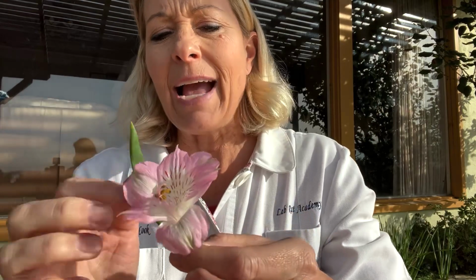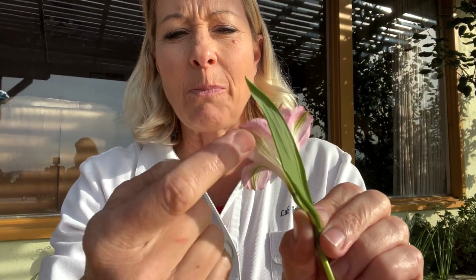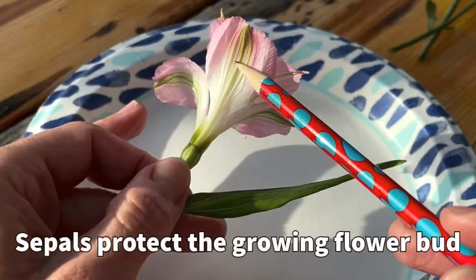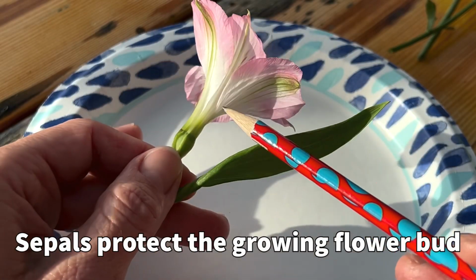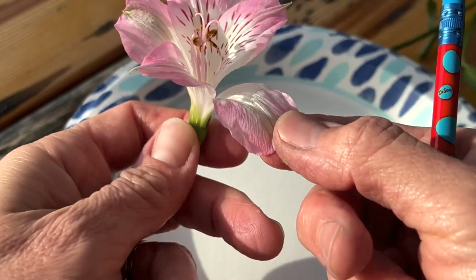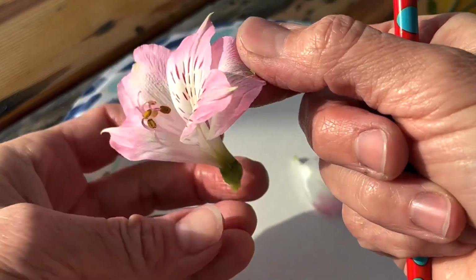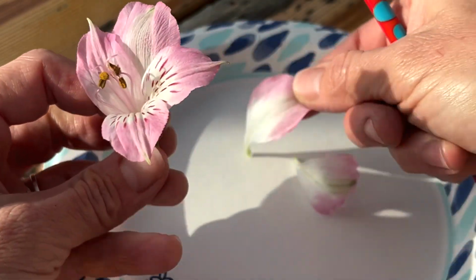You can see on the outside here, we have something that has green little parts right here, and these are called sepals. Those sepals are what protect the baby flower bud. I'm gonna pull these sepals off so I can show you what's next. So here's 1, 2, and 3.